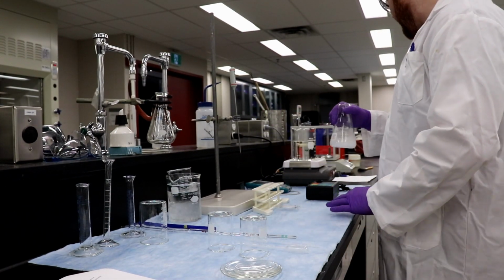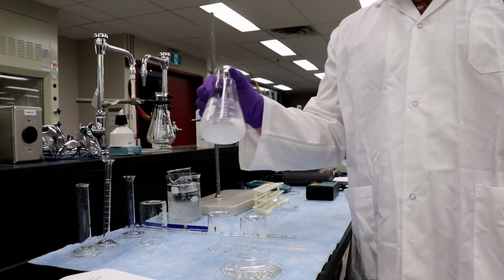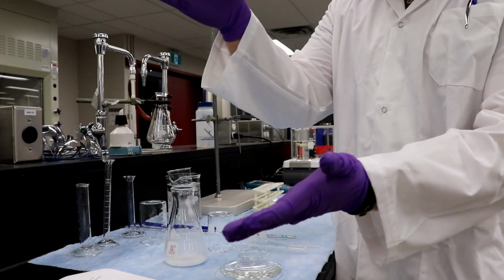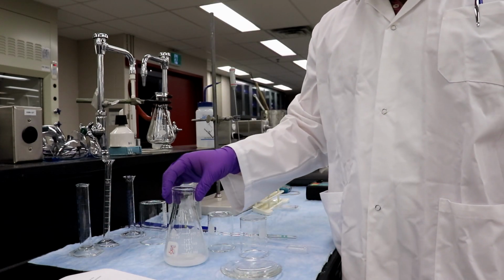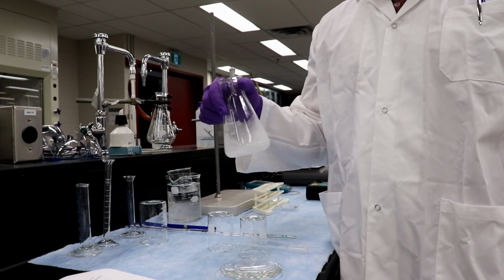We're going to wait for the water bath to get to 60 degrees. It's at 45 right now. And through the power of editing, it'll happen like this. Unless I don't know how to do that, in which case you have to stand here for 5 minutes while I wait for the water bath to heat up.